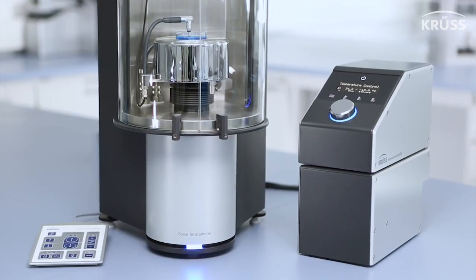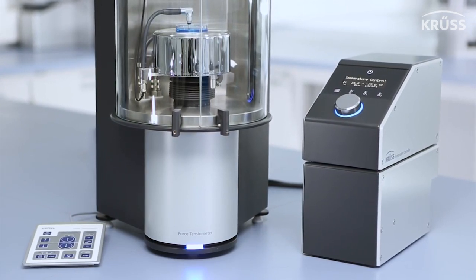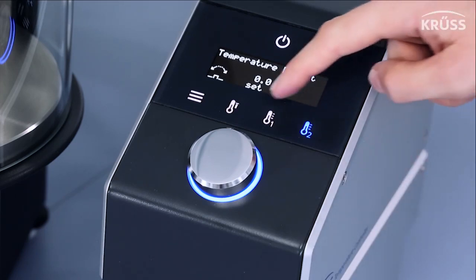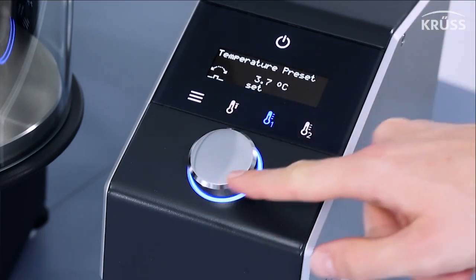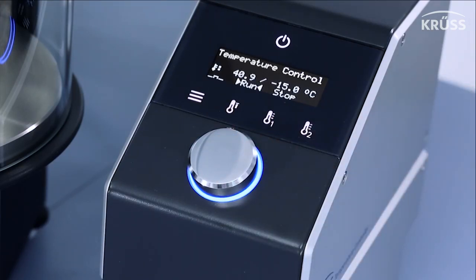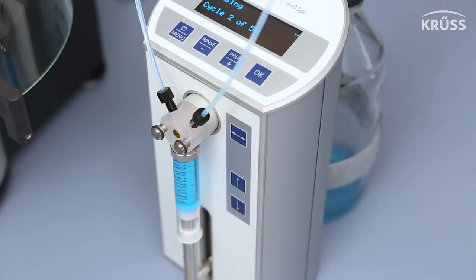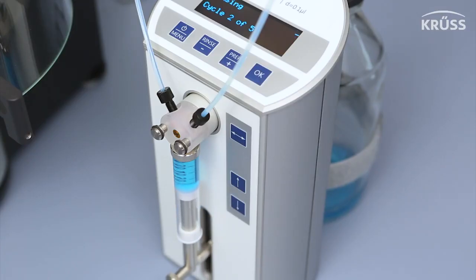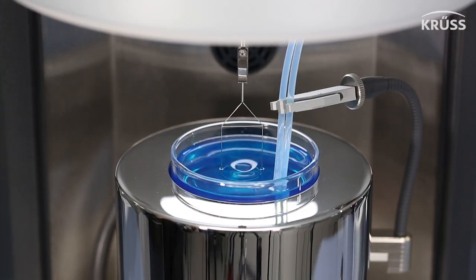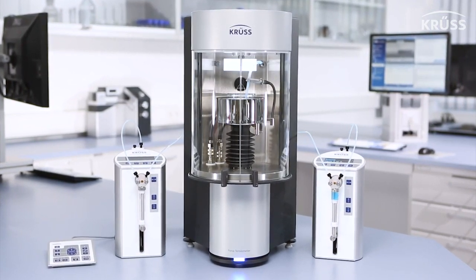A large family of accessories lets you customize your K100 setup. The Peltier and High Temperature Control Units enable you to intuitively and dynamically set the temperature of your sample from negative 15 to 300 degrees Celsius. When making critical micelle concentration measurements of surfactants, micro-dosing units control the exact concentration of surfactants in your test liquid, enabling a very wide concentration range with a high density of measuring points.